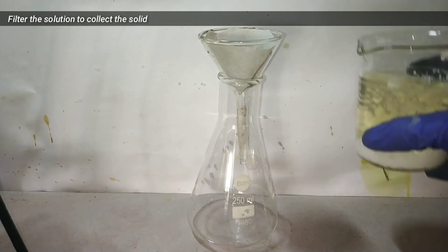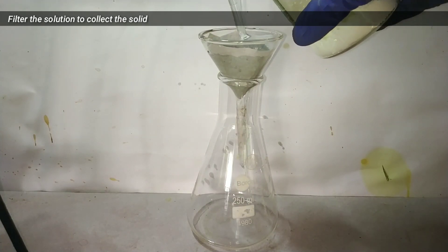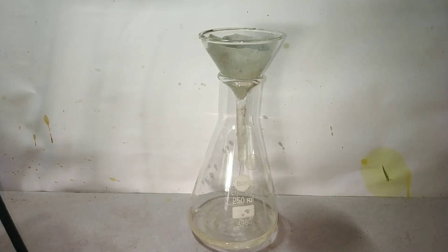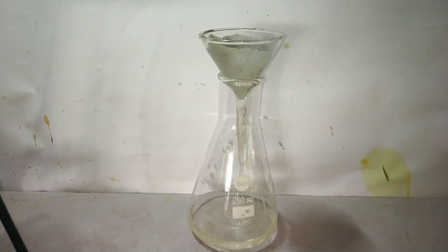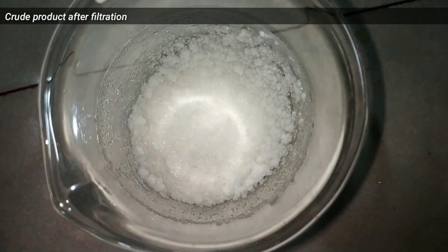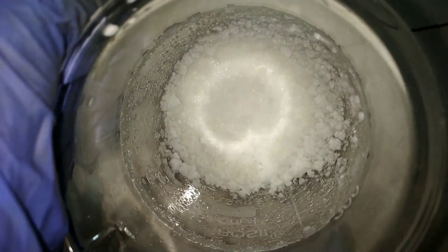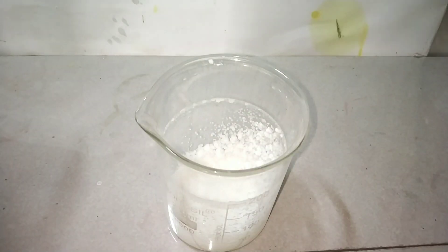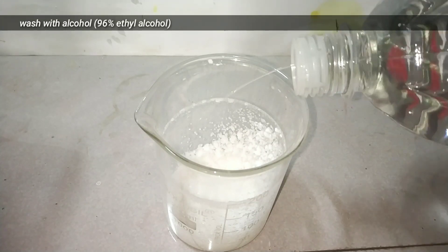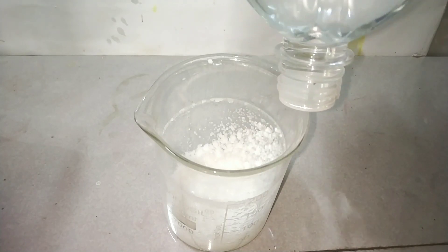Now I filter the solution to collect the solid using the gravity filtration method. After filtration, this is the crude product. I then washed the crude product a couple of times with ice cold distilled water and ethyl alcohol.